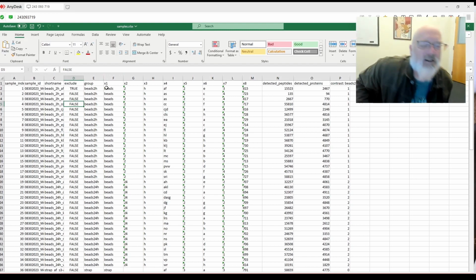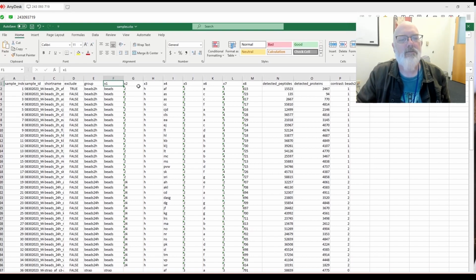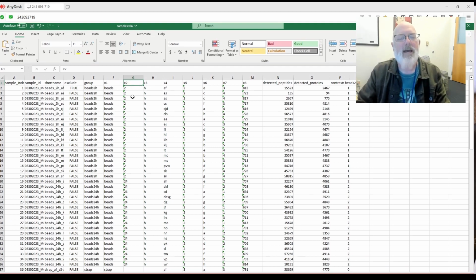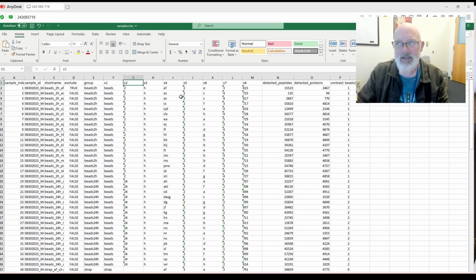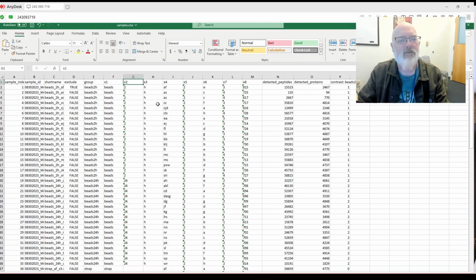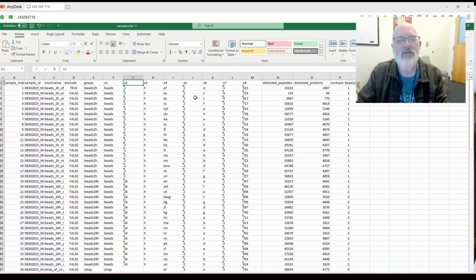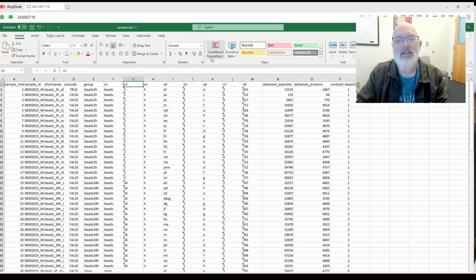But it looks like all of these other things that it's trying to parse out, we could have added other metadata here, like groups, maybe. Not groups, but maybe batches. So you could change this to batch, if you had different batches, for example. In the quick start guide of MS-DAP, there was a way to put in a random variable for batch correction, so maybe that would be a cool thing to do. Or you could put other metadata in here, like male or female, high blood pressure, or any other variable you want. And then maybe you can use that somehow in the analysis.